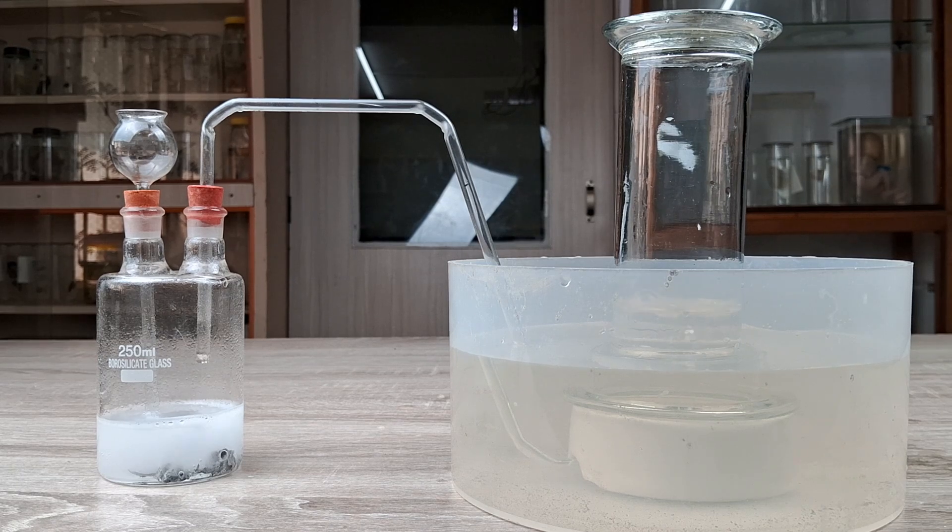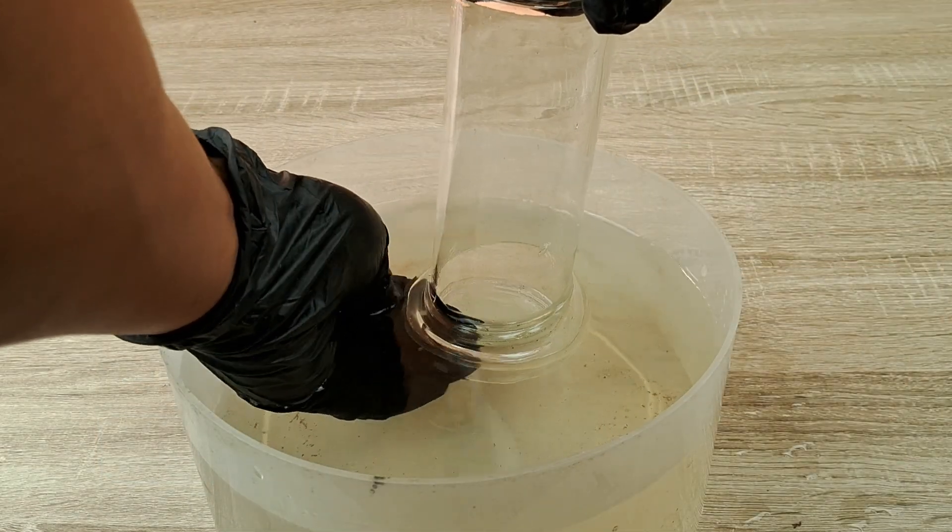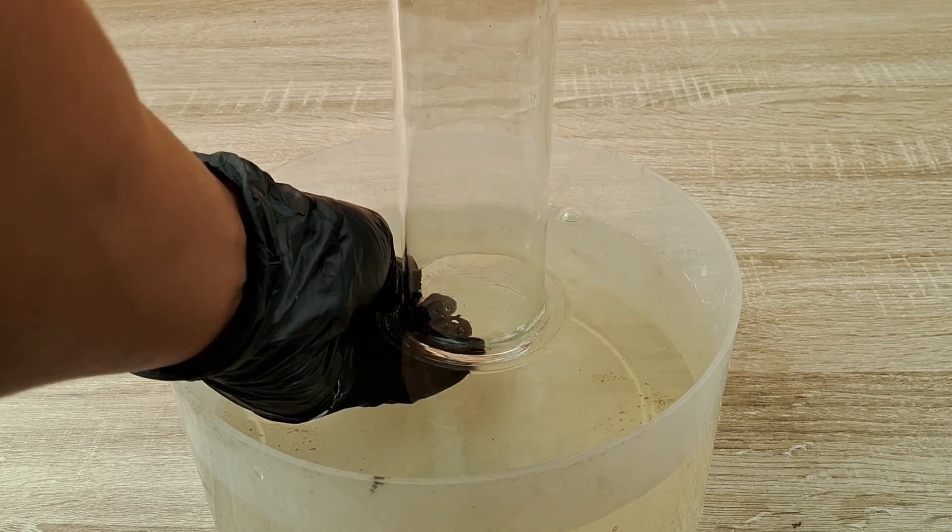Once it's completely filled, cover the mouth of the jar with a glass plate or a watch glass and remove the jar from the water.